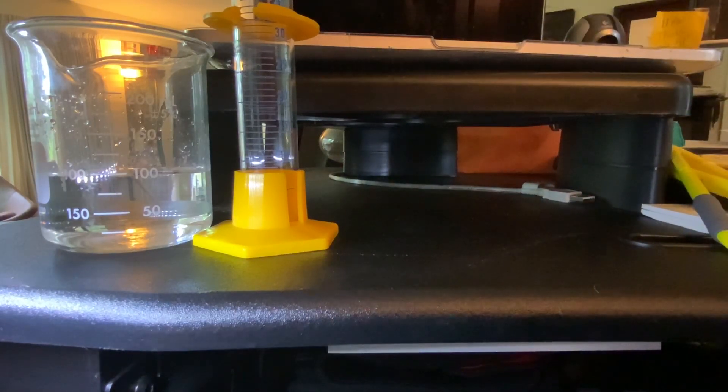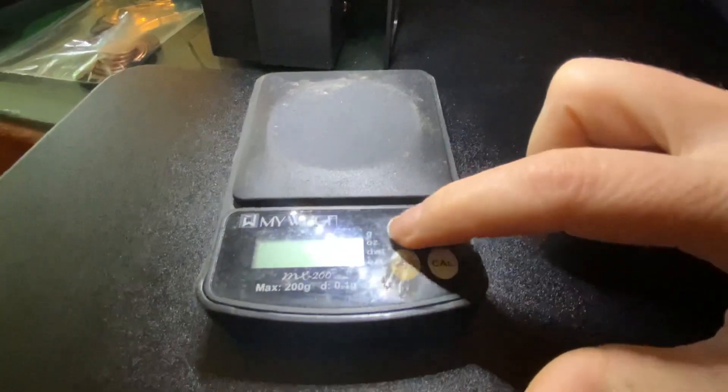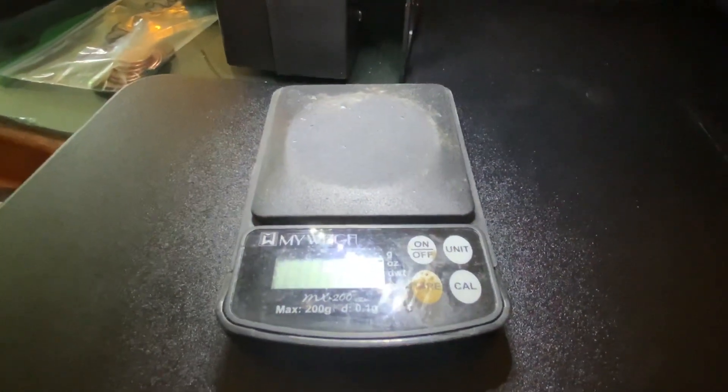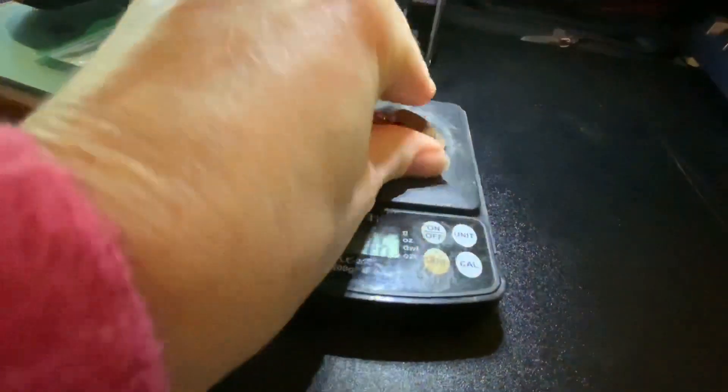I'm gonna go ahead and put them on the balance here. Turn that on. See that it shows zeros.